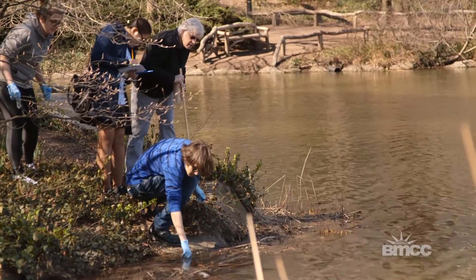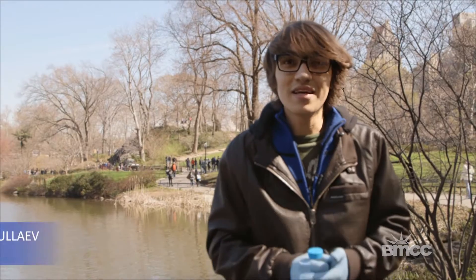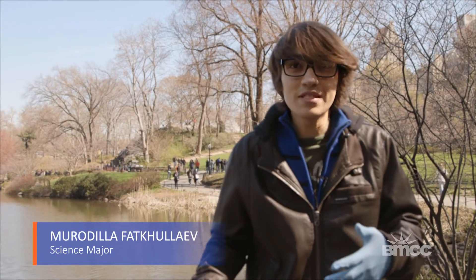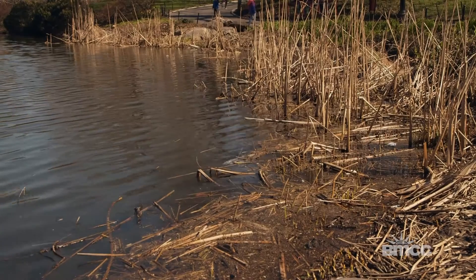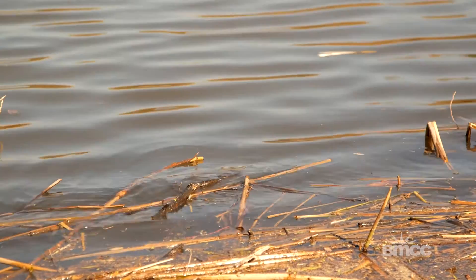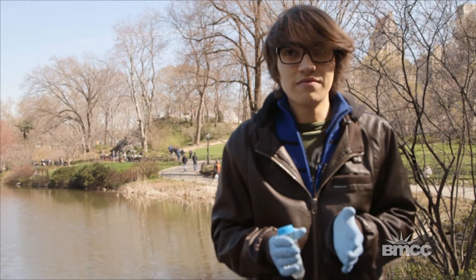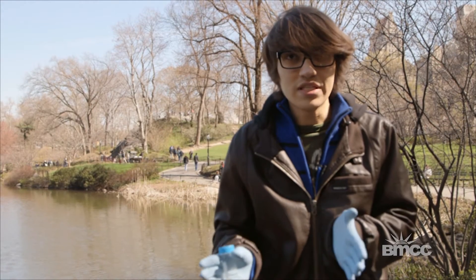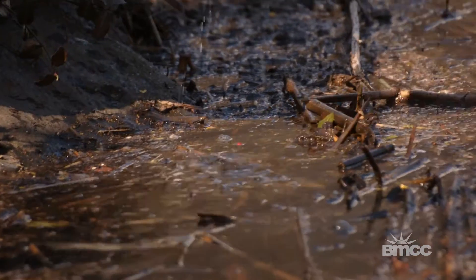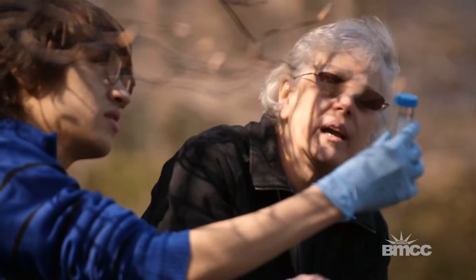I couldn't imagine in New York, in this busy city, it can be like there are public places with water. A lot of people come in contact with this water, and there might be very serious organisms in this water. Therefore I said, I really want to examine this water.